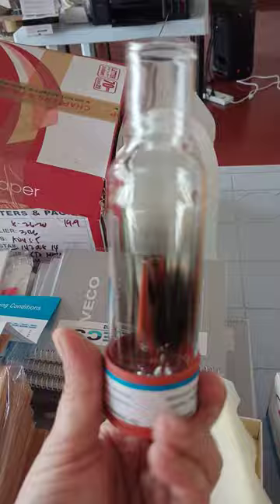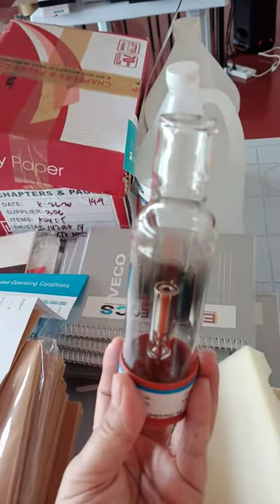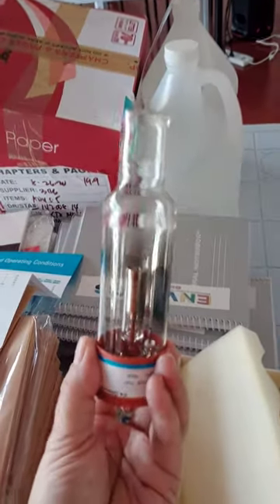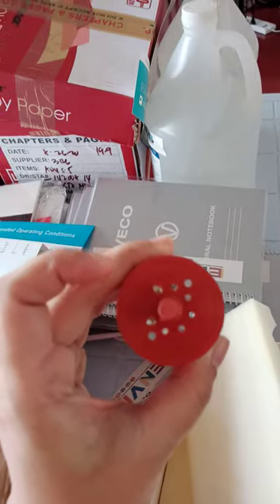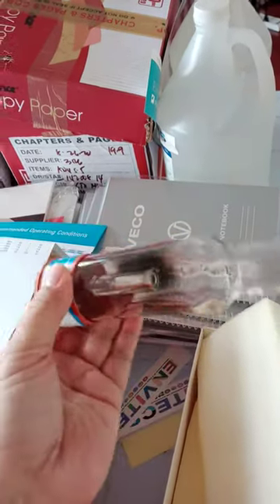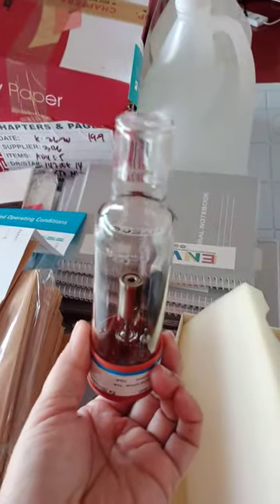This is the inside of the hollow cathode lamp. This is where you're going to place it — similar to an ordinary lamp.